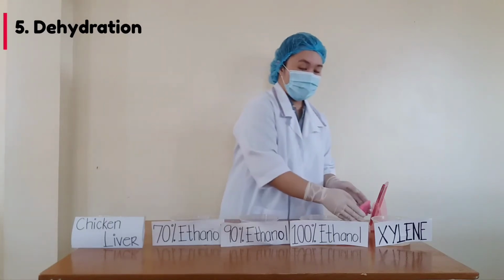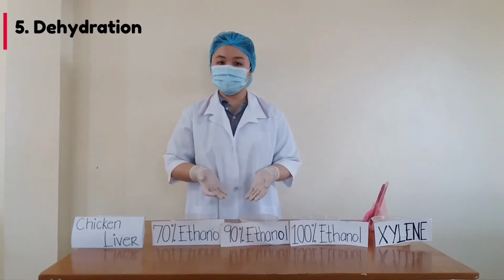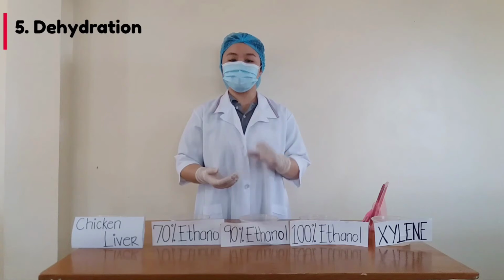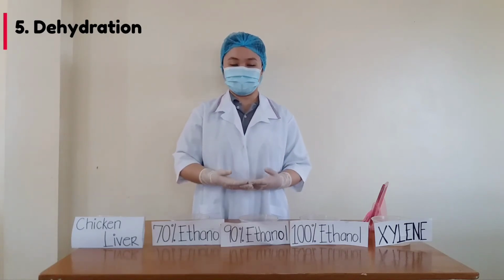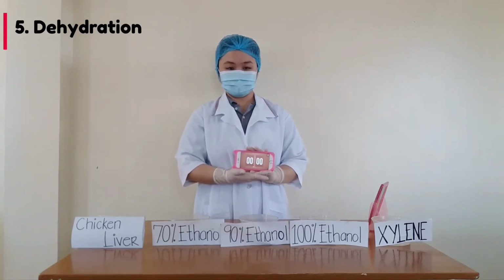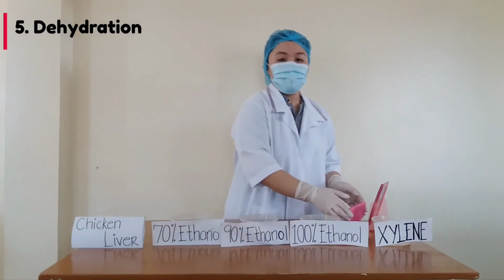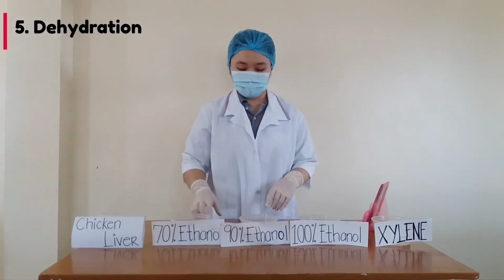The reason why we are submerging it first from a lower concentration to a higher concentration is to have minimal tissue distortion for better viewing and observation of our specimen. And lastly, we will now bathe it in 100% ethanol for 1 hour.